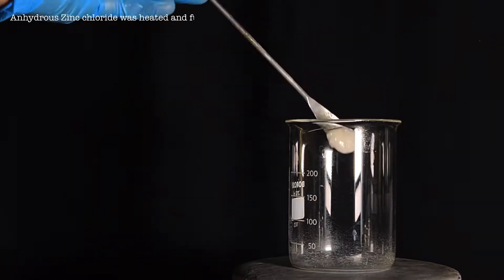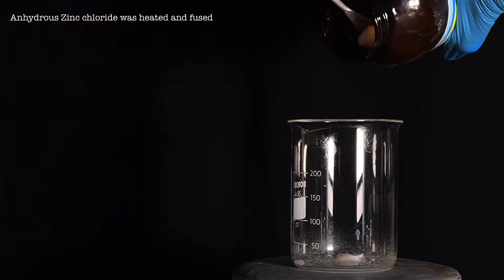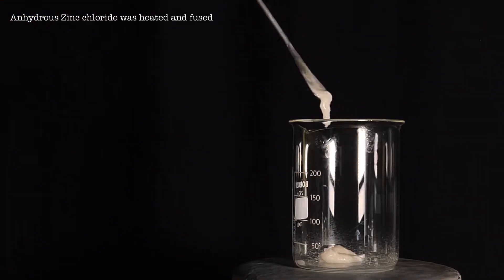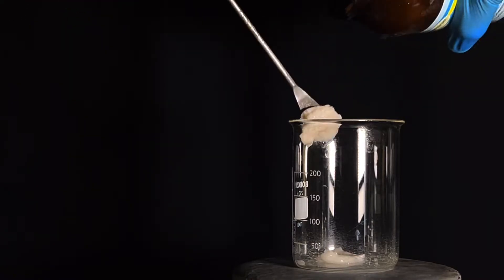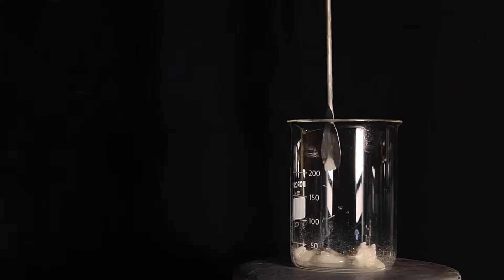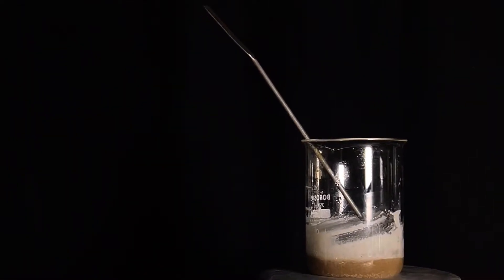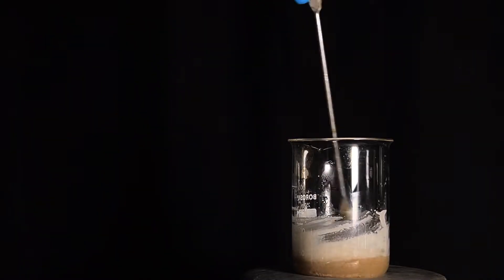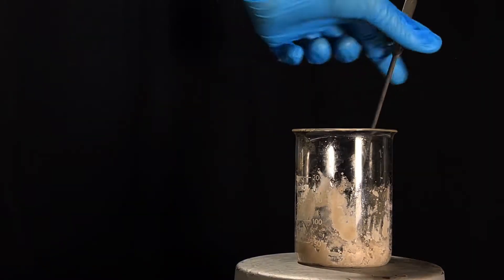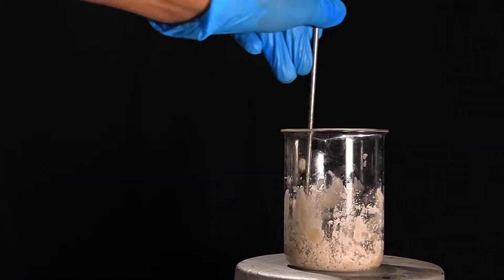The anhydrous zinc chloride I had was a bit old stock, so it was all moist and pasty, and I had to make it anhydrous again. For that, I transferred around 50 grams of the zinc chloride to a 250 ml beaker. The beaker was then heated with occasional stirring. After a few minutes on high heat, the beaker was cooled, giving us the anhydrous product.